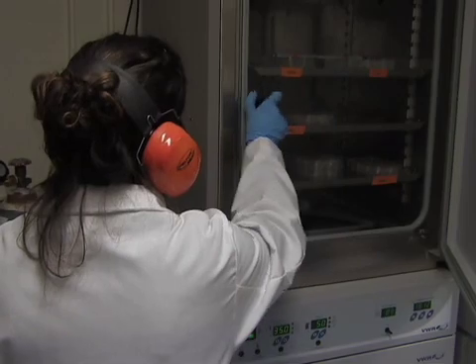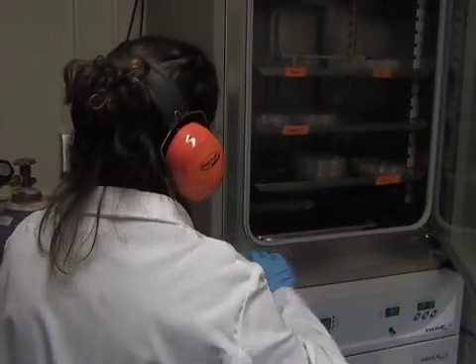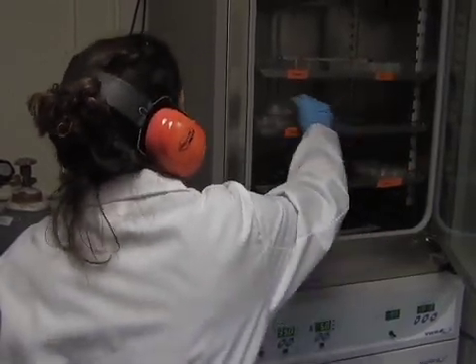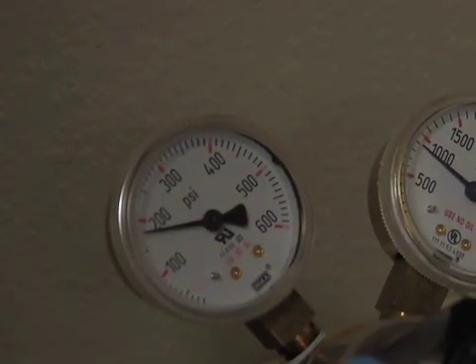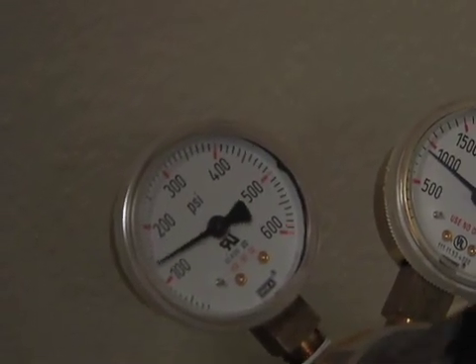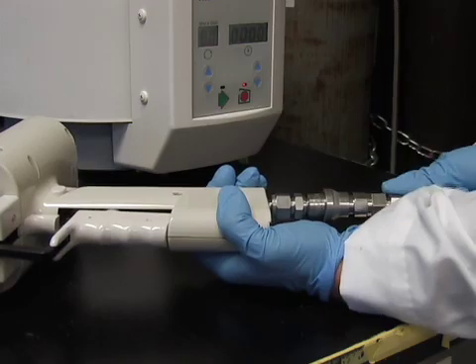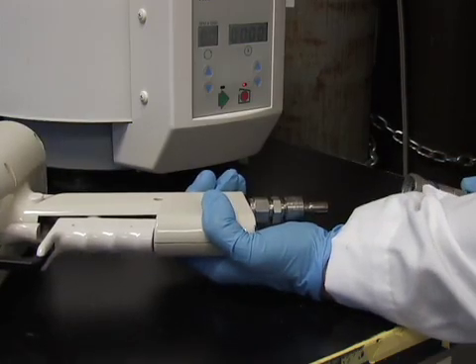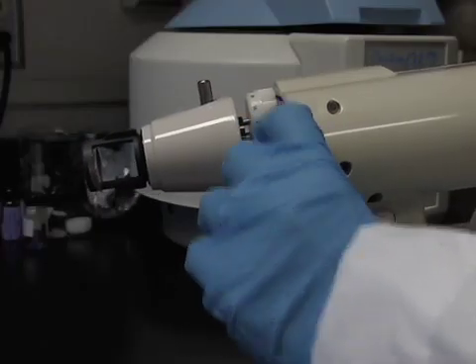Transfected cells can usually be examined within one to five days, depending on the construct. Once all the wells have been shot, turn off the gas and release the pressure before detaching the gun from the helium hose. Remove the cartridges and the used shells.